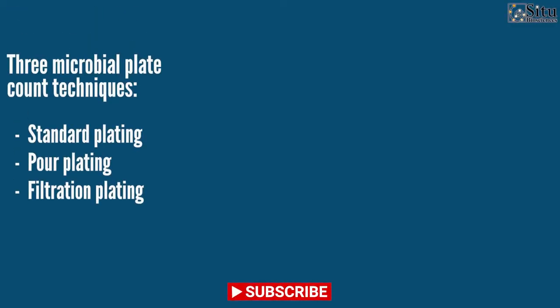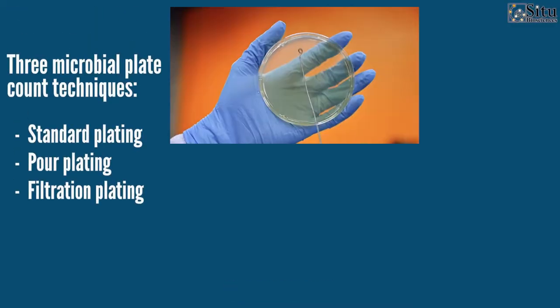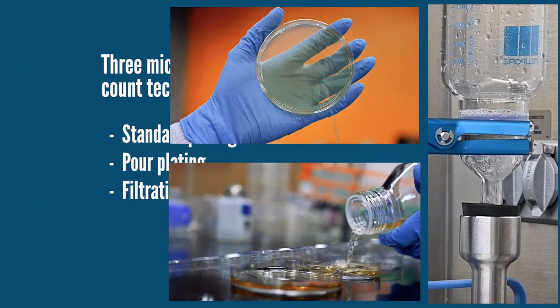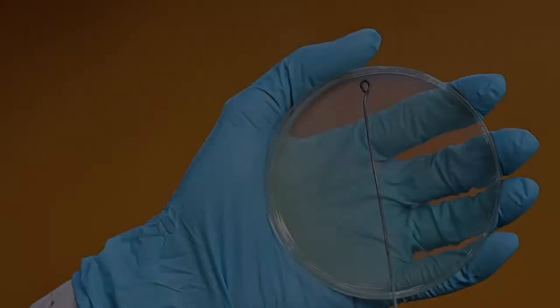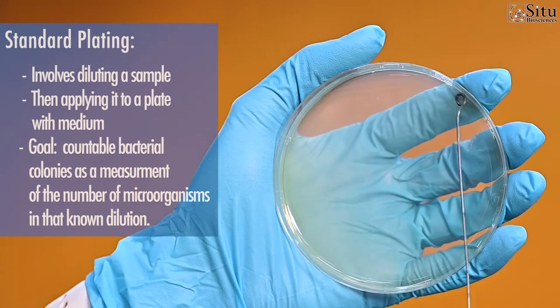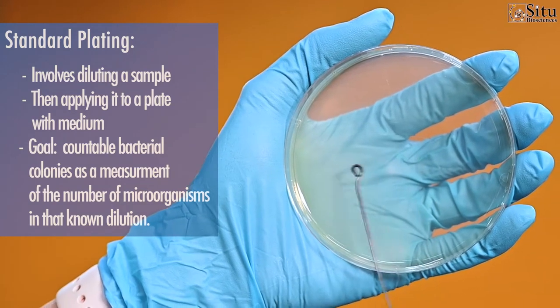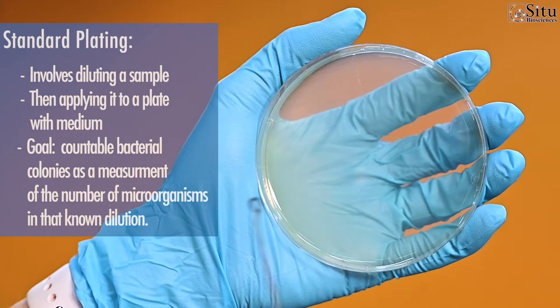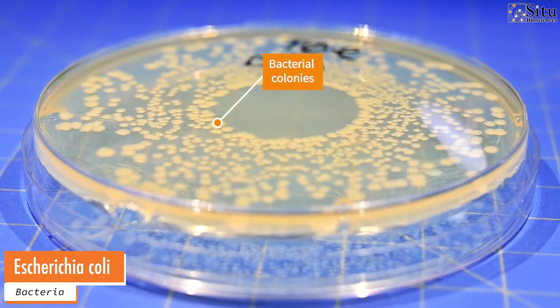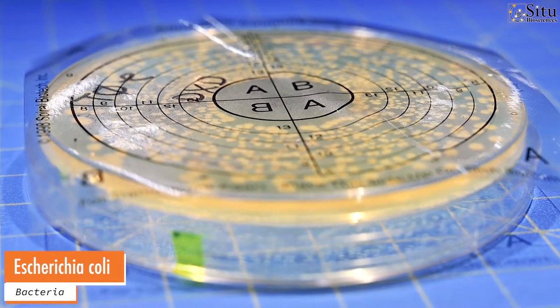Three microbial plating techniques widely used are standard plating, pour plating, and filtration plating. Standard plating involves diluting a sample and then applying it to a plate with a medium in order to discern countable bacterial colonies as a measurement of the number of microorganisms in that known dilution.